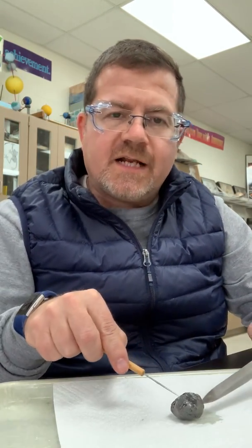This is a little bit of potassium. Potassium is so reactive that it actually has to be stored under oil, which is pretty crazy. But it's so incredibly reactive that we have to do that. So what I'm going to do is cut a very small piece of it here. I need to angle the camera slightly so you can see this better. So we have a little teeny piece of it here. This is what it kind of looks like.